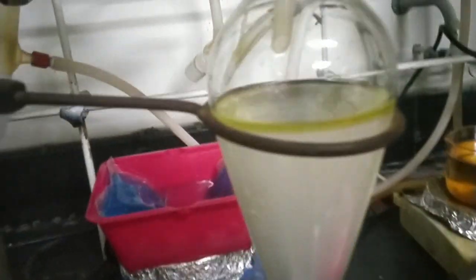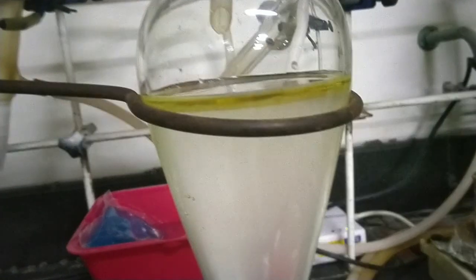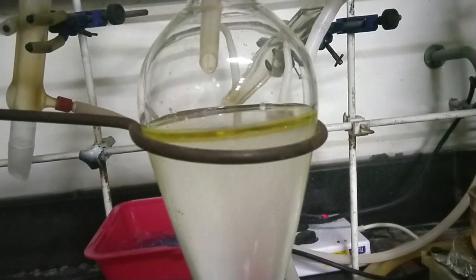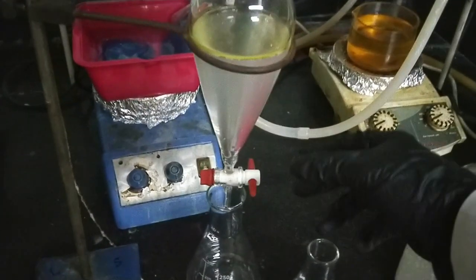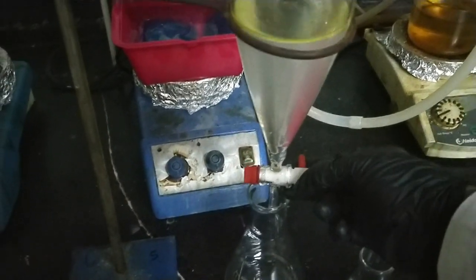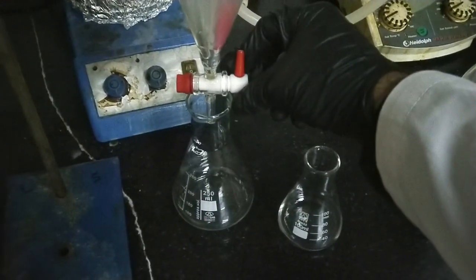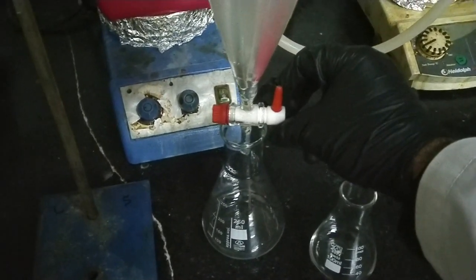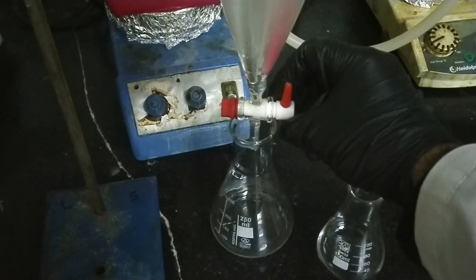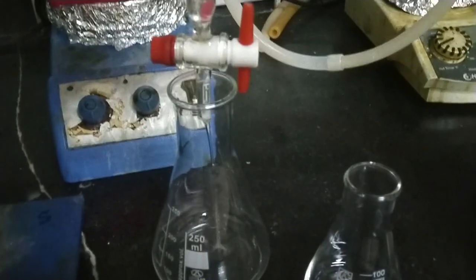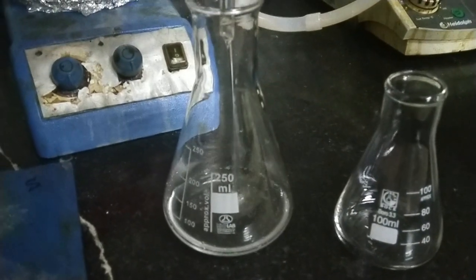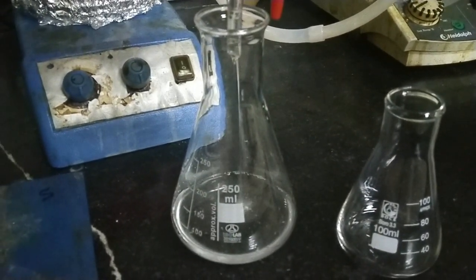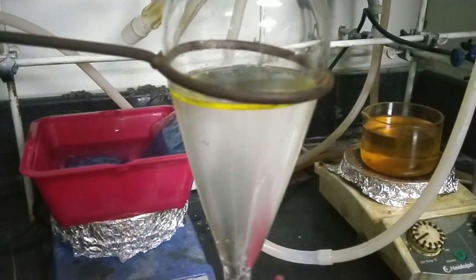As you see in the decanter, there are two phases. The upper oily phase is tertiary butyl hypochlorite, so it's time to decant. Decanting the reaction mixture, discarding the water phase, bring it until it reaches the oily phase.